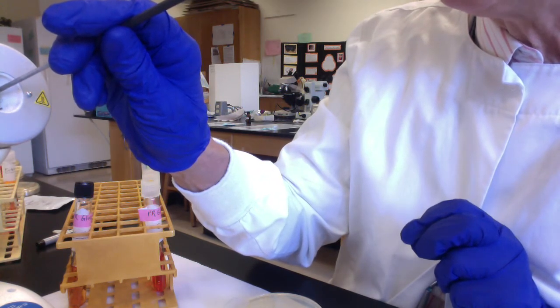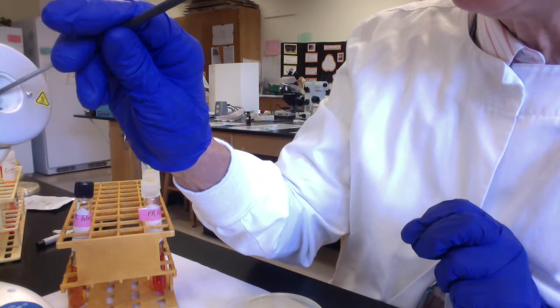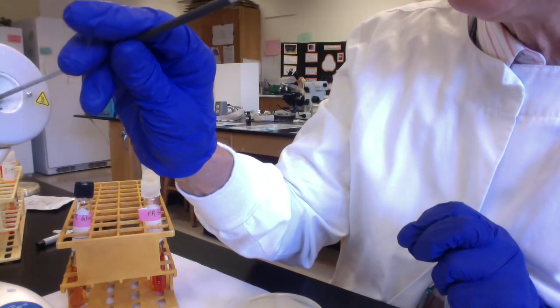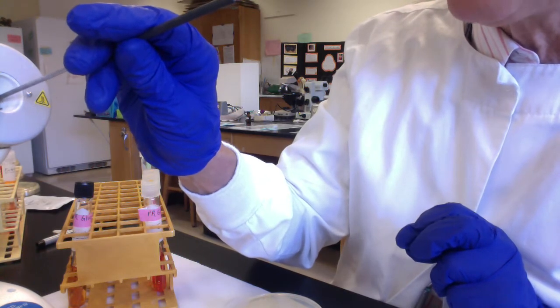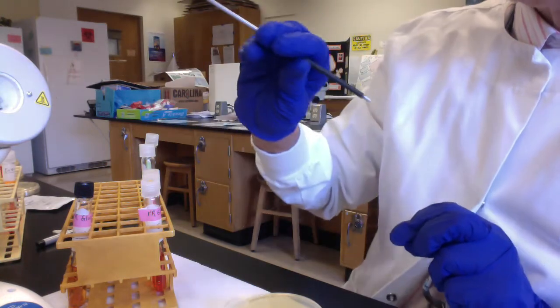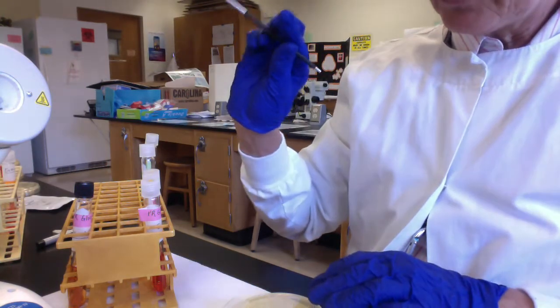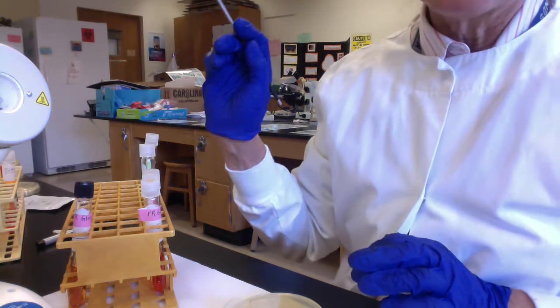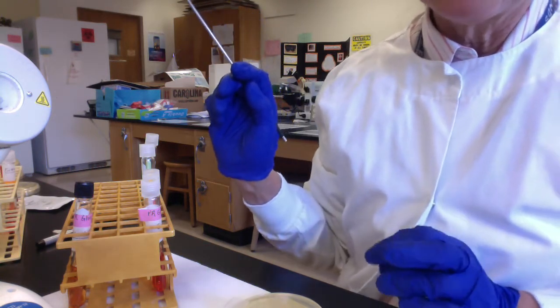So we know that E. coli can ferment glucose. It uses a specific fermentation pathway called the mixed acid fermentation pathway, but we'll come back to that. In doing this test, we'll get to see if, in addition to glucose, E. coli can also ferment lactose and sucrose. Now, if you're going to ferment a sugar, it's going to be glucose.